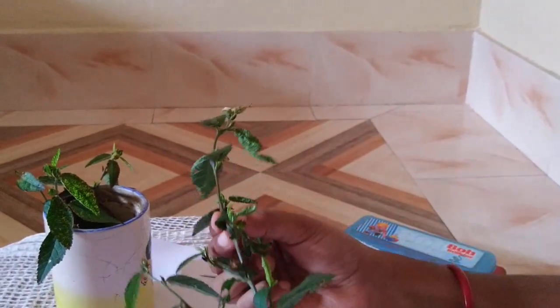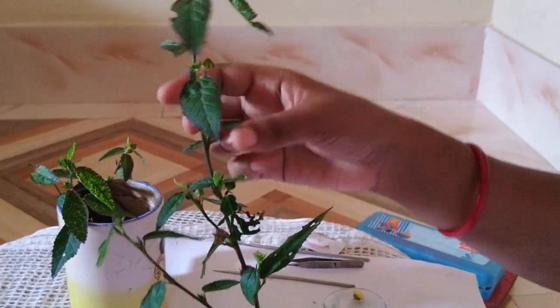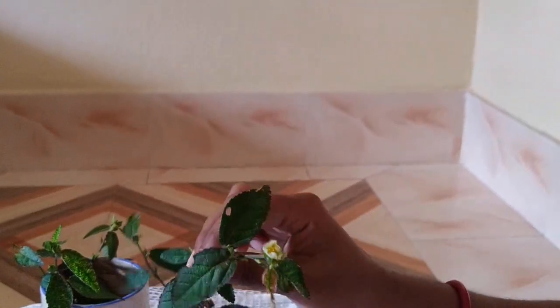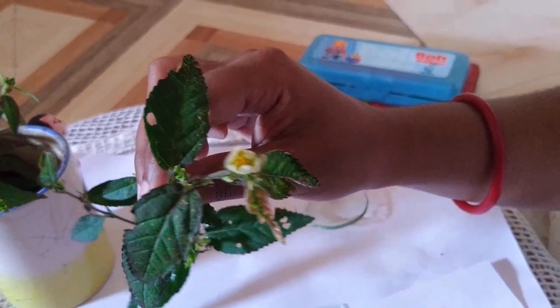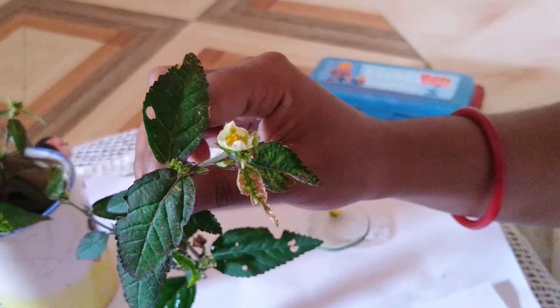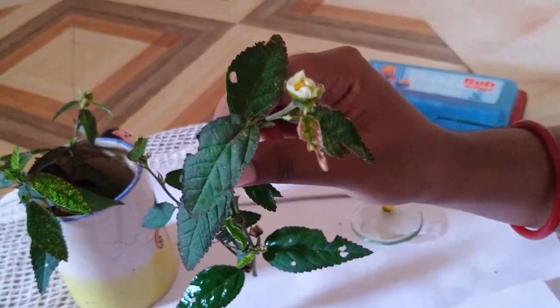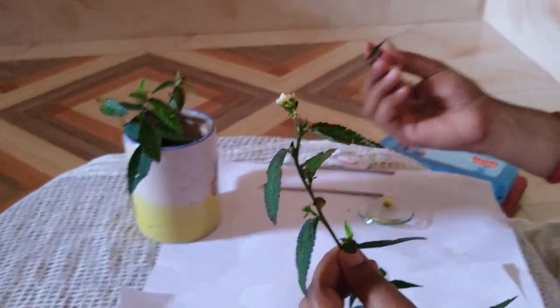The stem is cylindrical in shape. If we look at the top, we can see that the flower is single and solitary. The inflorescence type is cymose type. For more detail, we have to dissect the flower. Let's try to dissect the flower.